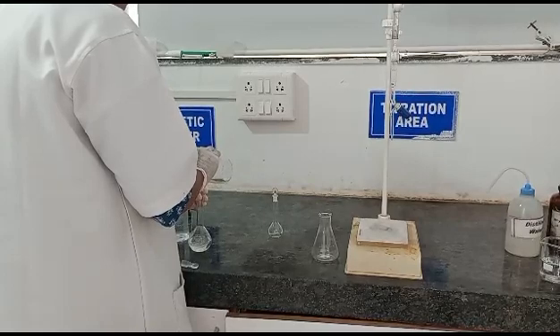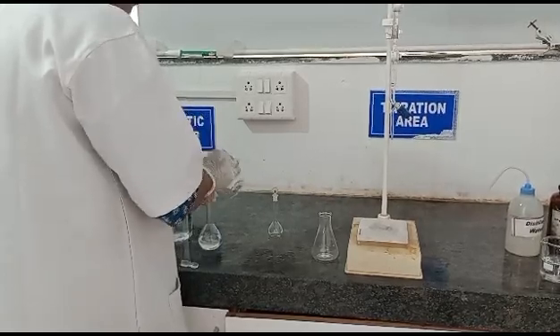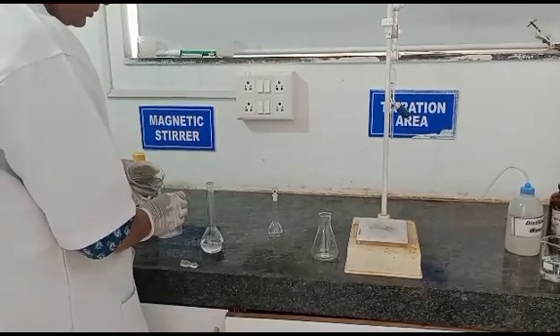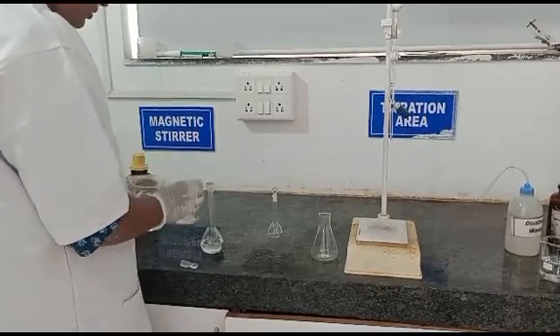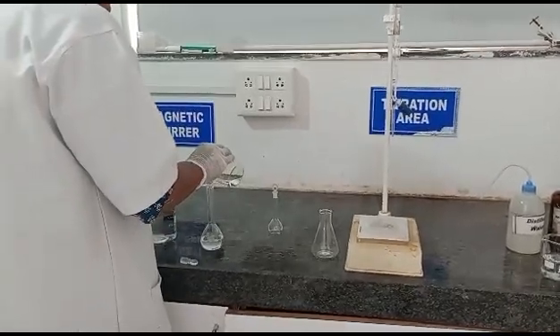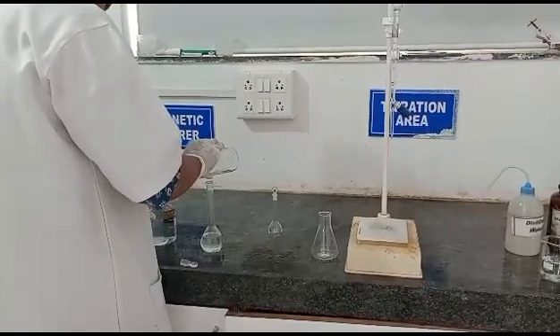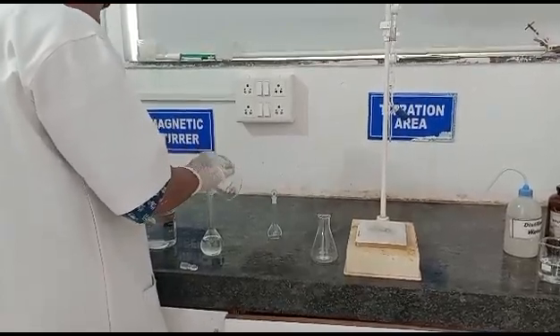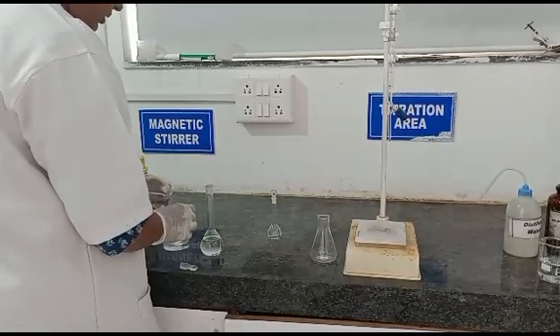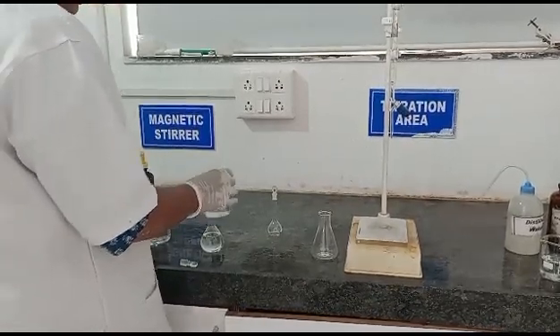Transfer the liquid carefully. Now rinse this beaker with some distilled water and transfer it into the volumetric flask. Now make up the volume to 100 ml with distilled water.